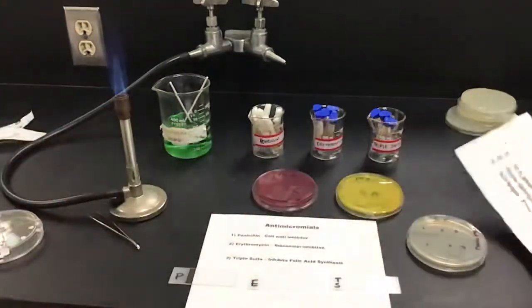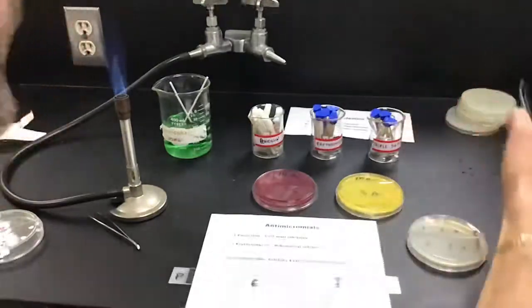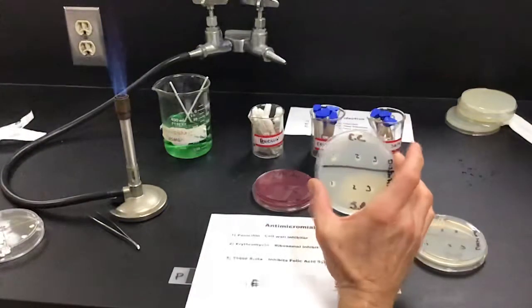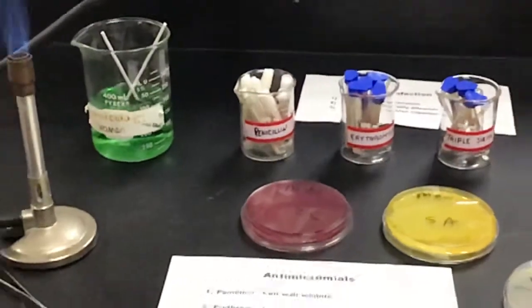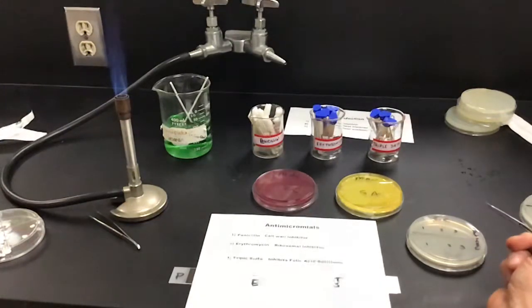Okay guys, so we're gonna do our continuation from our disinfectant lab we did previously. We did our other lab, we checked the effectiveness of disinfectants on E. coli or Staph aureus. Now I'm gonna do the same thing with antibiotic discs. This is gonna simulate the Kirby-Bauer test. So you'll also be checking for zone of inhibition using antimicrobials, all right?